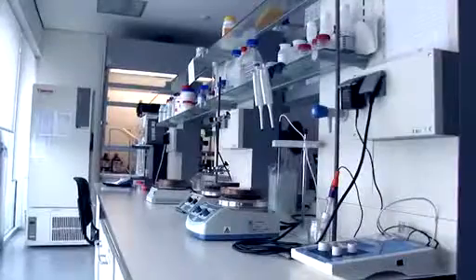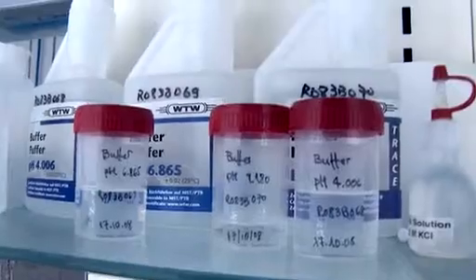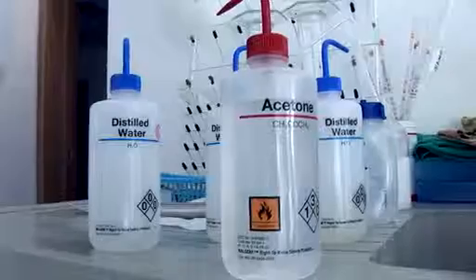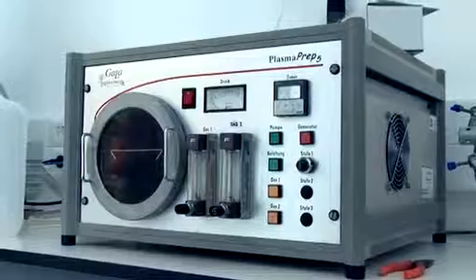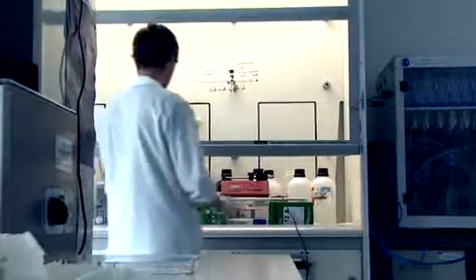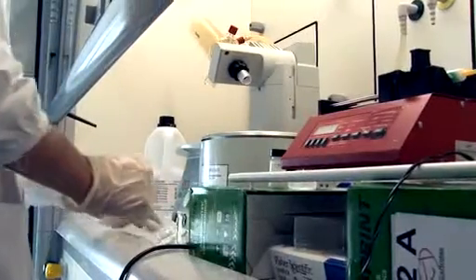Chemistry labs. Standard chemical laboratories exist for a variety of purposes. Dissolution and purification of different raw materials by means of standard chemical procedures. Development and modification of new polymeric structures, membranes, composites, hydrogels, by means of chemical and enzymatic approaches.